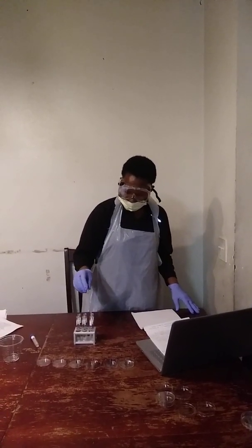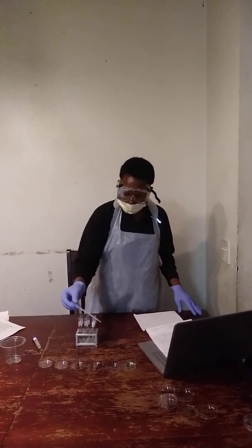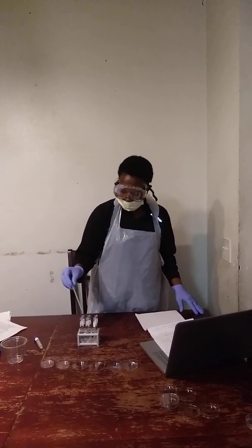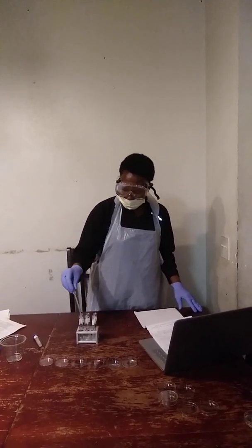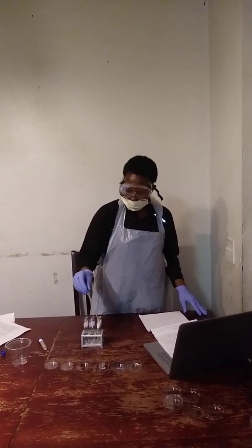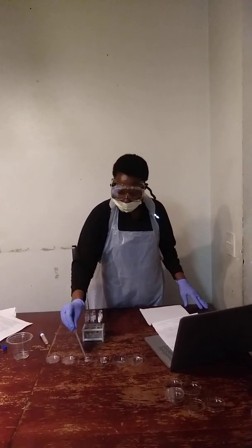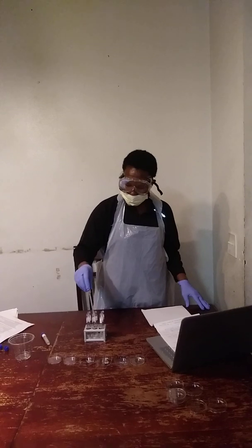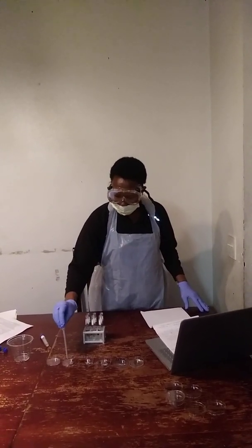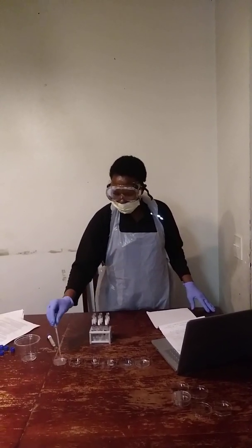One, to plate number 2, to plate number 3, to plate number 4, to plate number 5, and to plate number 6.